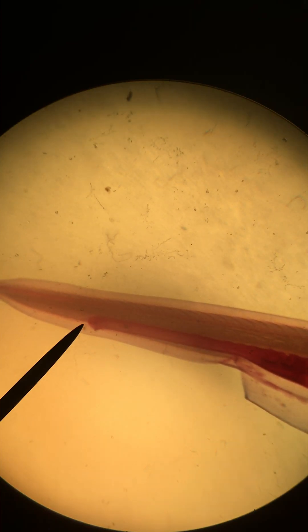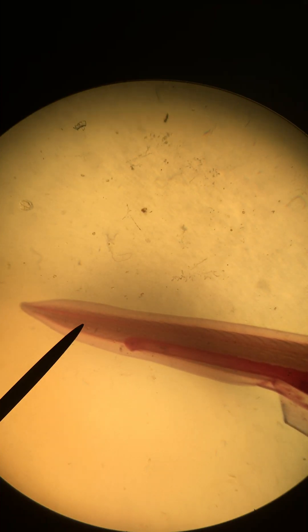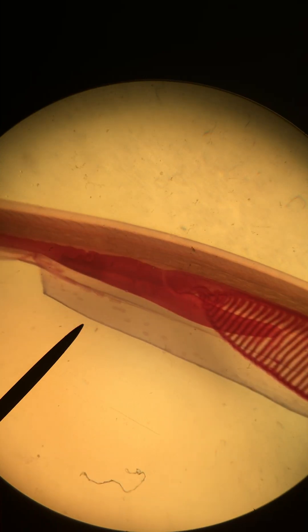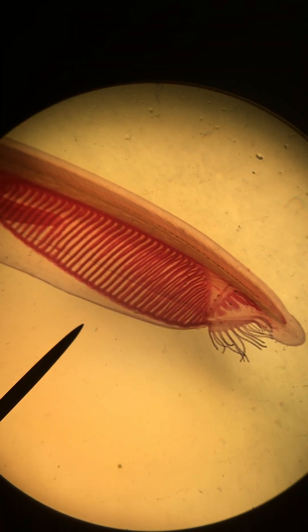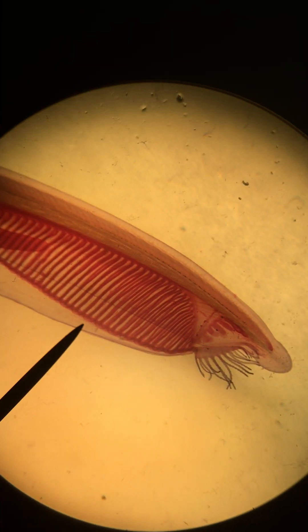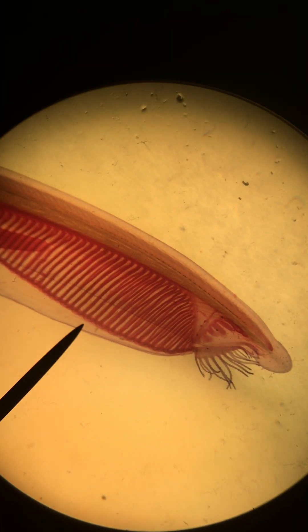I think we've covered pretty much everything for this section. Next, we're going to look at the same organism, the amphioxus or the lancelet — same organism, but in cross section, so you can see what some of these structures look like in a different cut.